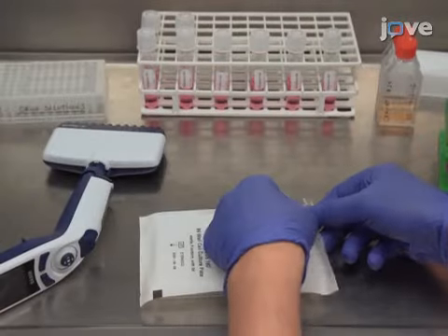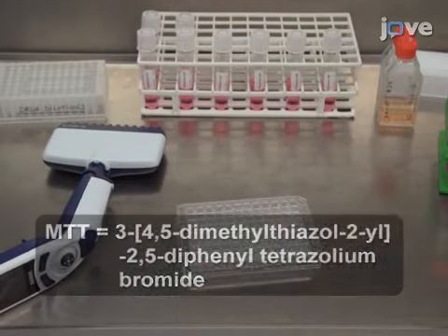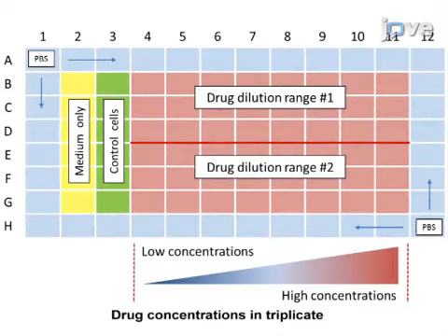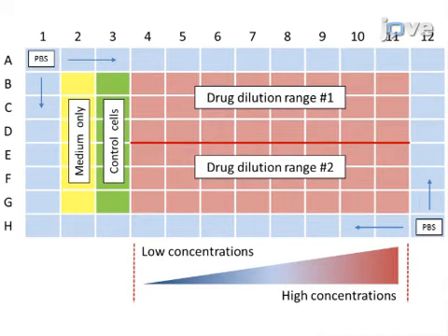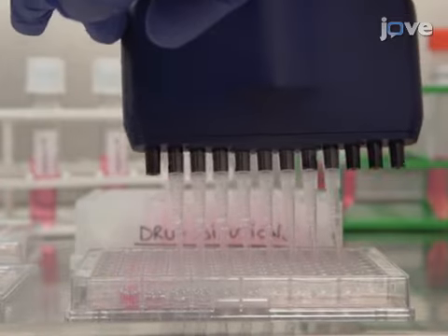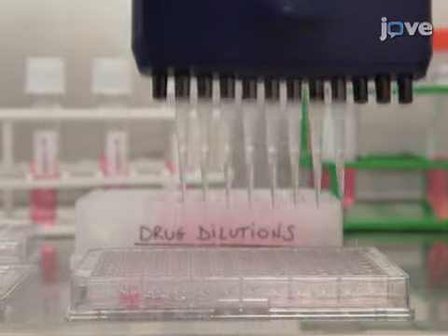To perform the MTT assay for leukemic cells, prepare a 96-well flat-bottom experimental plate. Dedicate wells to drug concentrations, to control cells, and to control medium without cells. Prepare a drug dilution range of dexamethasone, or DEX. Add 30 microliters from each DEX dilution into an appropriate well of the 96-well plate. Make sure to include each concentration in triplicate.